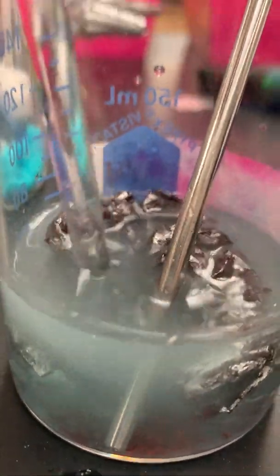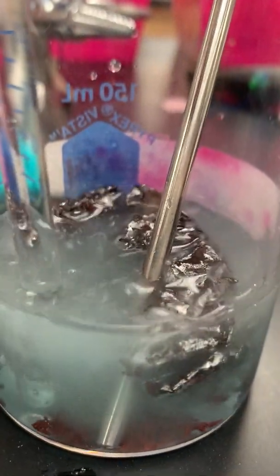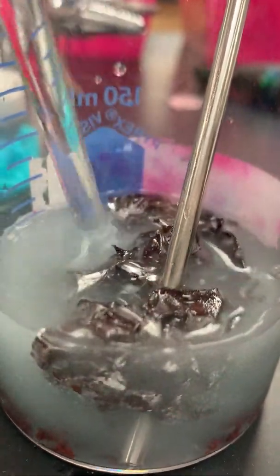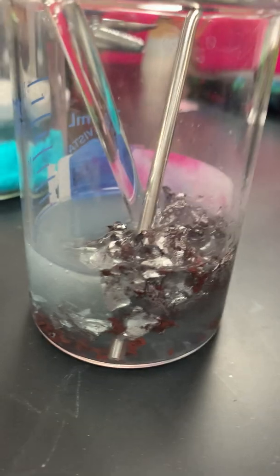As you can see, the result is this sort of reddish brown chunky stuff at the bottom. And we've ended up with a much less blue liquid. It's much more of a grungy, clearish gray color. And the aluminum foil kind of fell apart a little bit. There's still some of it left, but it's really started to fall apart and break into this brown stuff. Okay, so record all your observations in your data table.